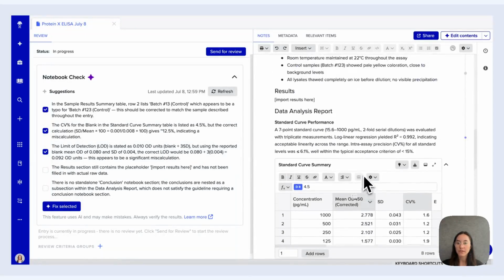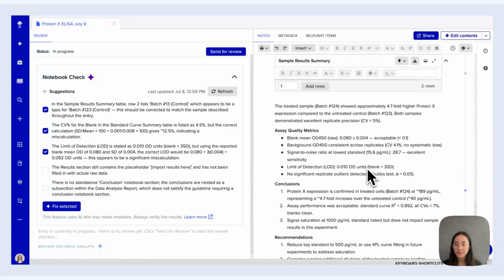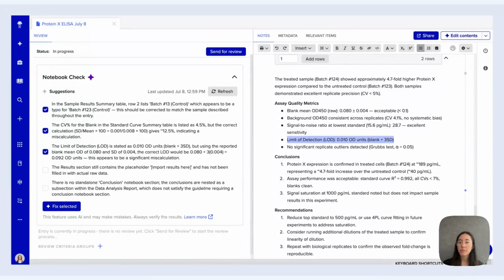And then last but not least, we also have the limit of detection. So if we try to find where that's mentioned here, let me scroll to where that is described. You'll see that the limit of detection is noted here as 0.010. But if I use the reported blank mean and the OD of 0.080 and standard deviation of 0.004, which you see listed in this suggestion here, the actual calculation is not 0.010, it's actually 0.092. So it's probably a miscalculation or some sort of rounding issue that happened here. So this is also another great way for me to then be like, okay, this is something I want to fix and is incorrect, and I've caught it early enough that hopefully there hasn't been any sort of unexpected or undesired downstream impact. So now I can obviously review the remaining ones. In the interest of time here, I'll just proceed with assuming that these three are suggestions that are valid and I want to actually apply them to my notebook entry.